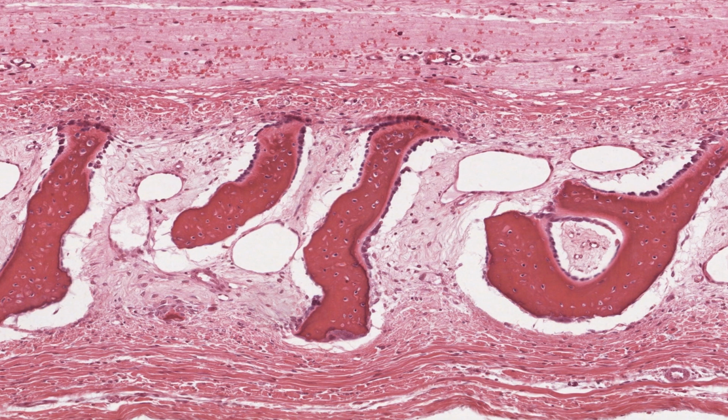The area between the bone spicules is filled with loose, undifferentiated mesenchyme. Note it's highly vascular, with very large spaces being developing blood vessels. Earlier in the development of this bone, some of these mesenchyme cells would have differentiated into osteoprogenitor cells, which would have then proliferated and differentiated into osteoblasts.